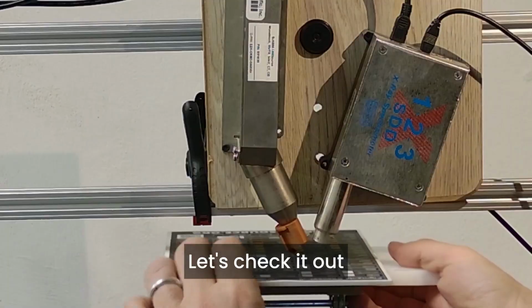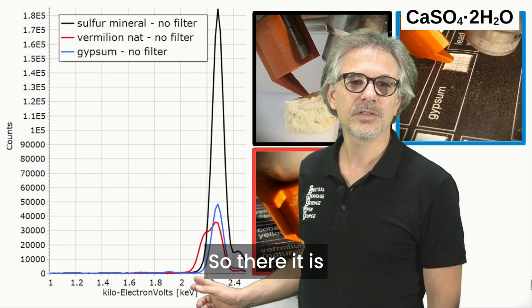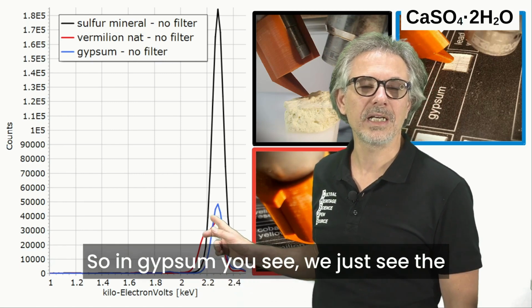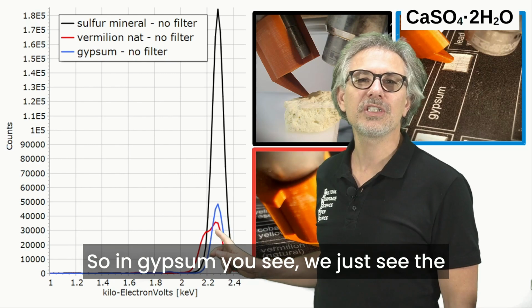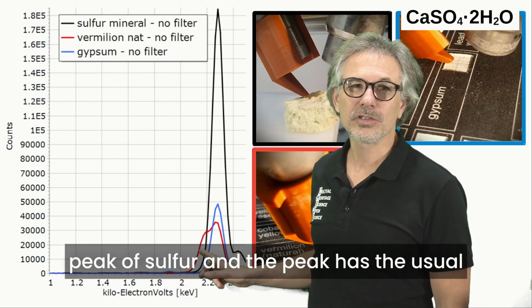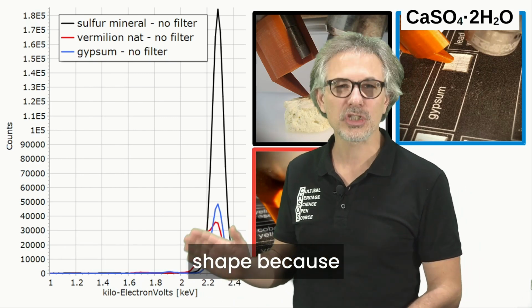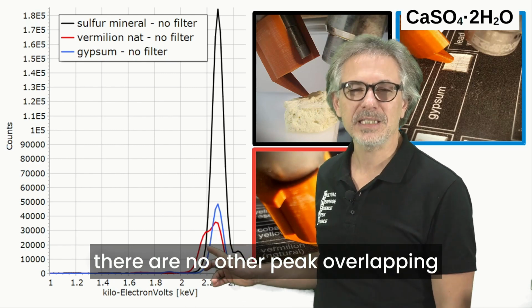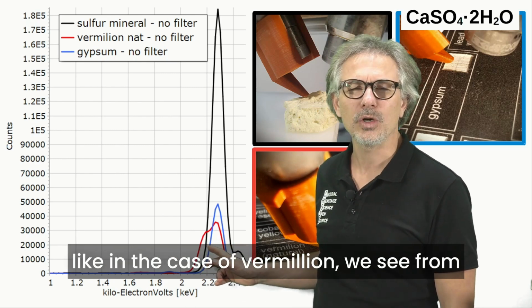Let's check it out. So there it is, this is the spectrum of gypsum, the blue one. In gypsum we just see the peak of sulfur, and the peak has the usual shape because there are no other peaks overlapping, like in the case of vermilion.